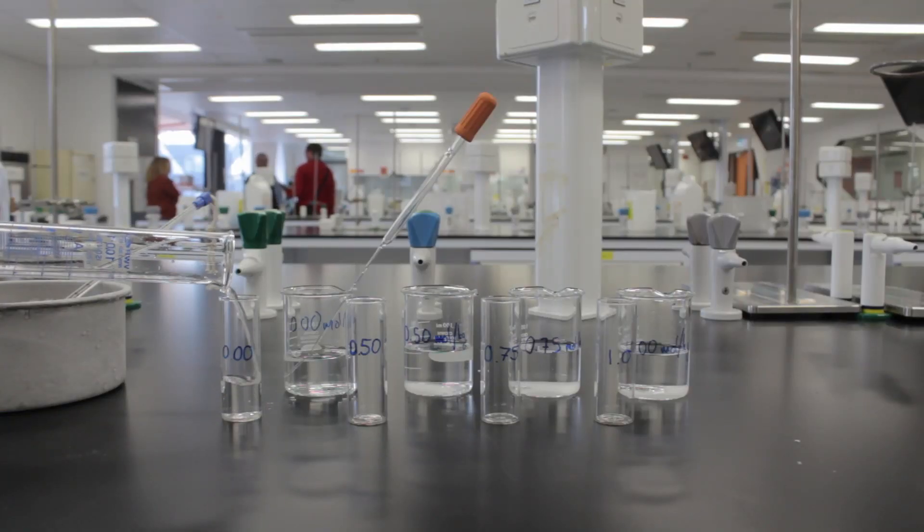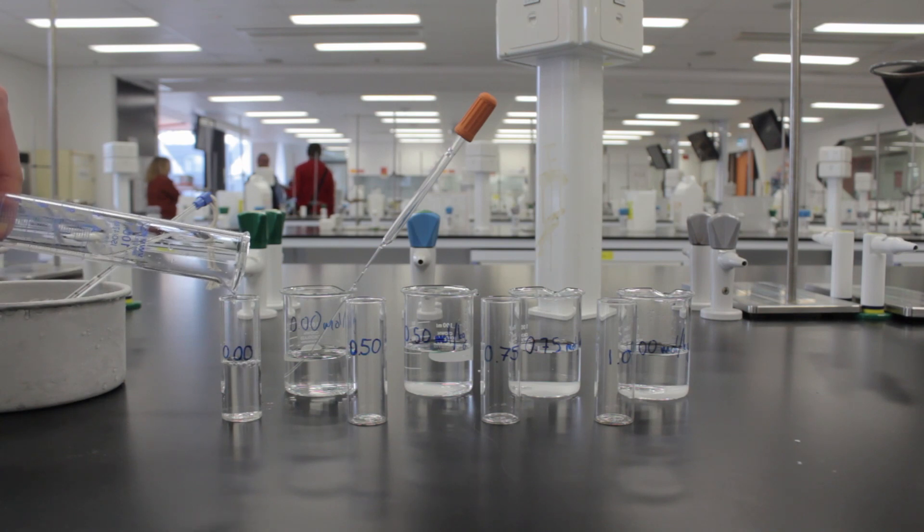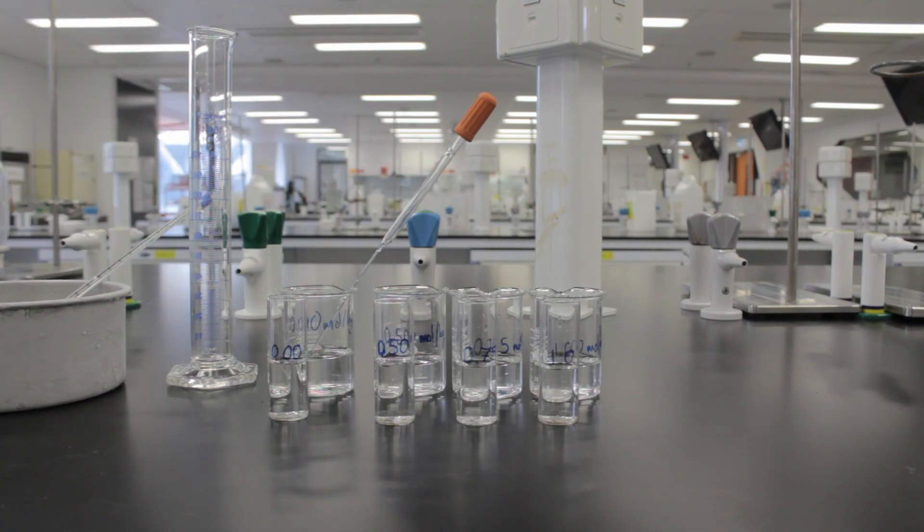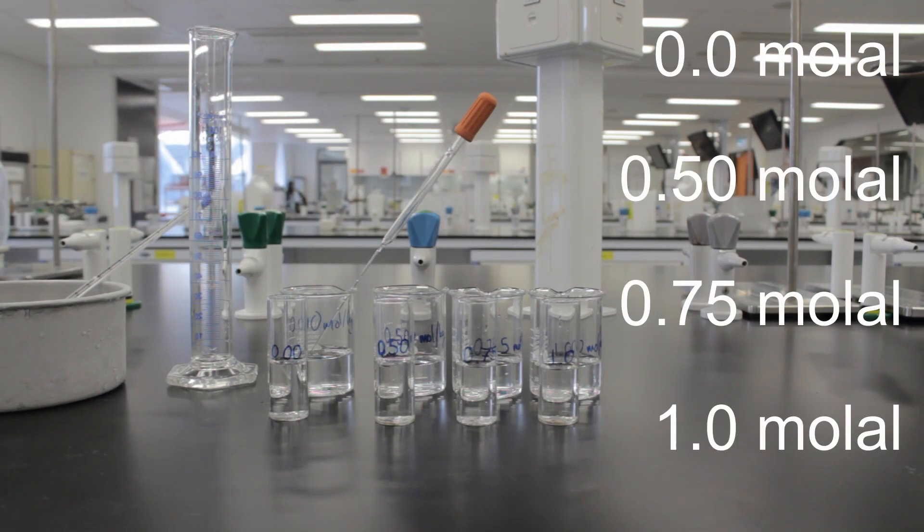Fill one labeled test tube with 15 ml of water to create your zero molal solution, then transfer the rest of the solutions into their test tubes. Now we have four molalities of salt solutions that we can analyze.